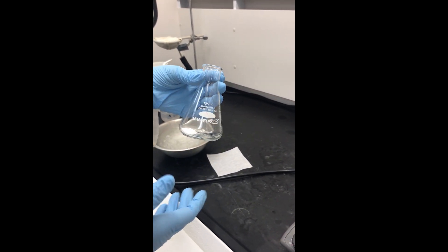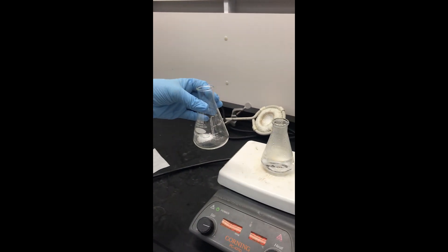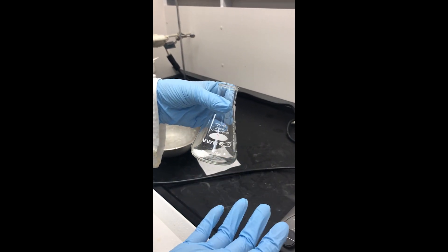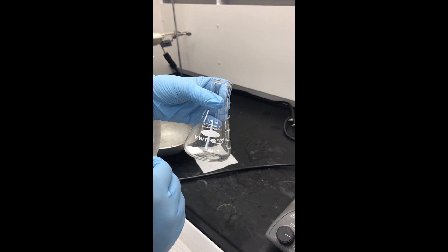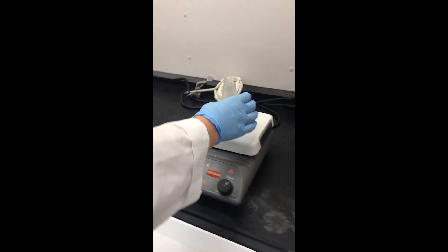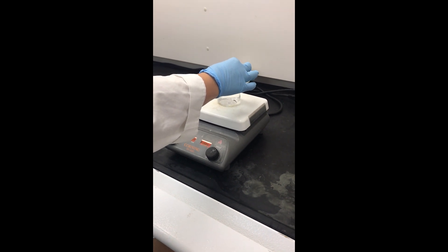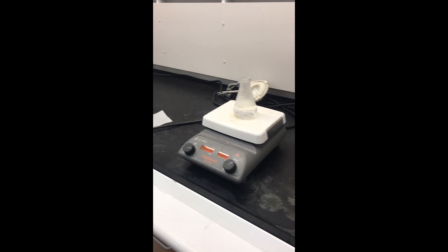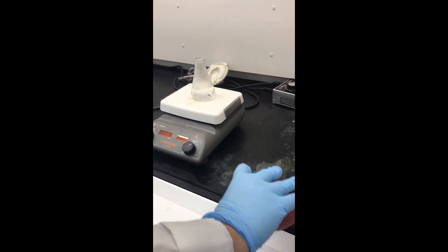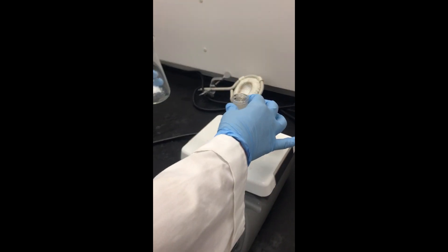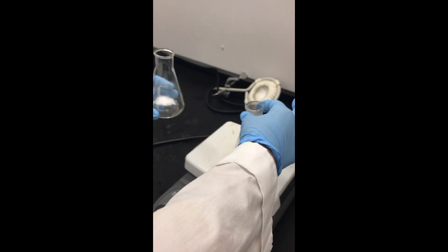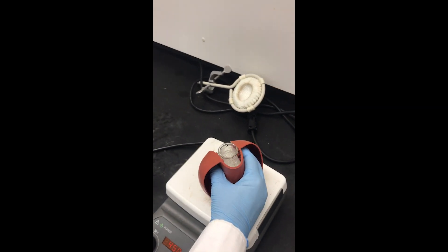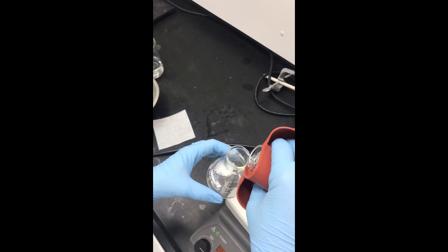I don't want to put this on the hot plate right now because the hot plate is hot and it may melt the solid. You can put it on the hot plate once you have water in there or your solvent in there but not before then. I can kind of touch it and see if I feel comfortable with that temperature. If I didn't, I might want to use a hot mitt. Actually that's a little too hot, so I'll use a hot mitt just to be safe.